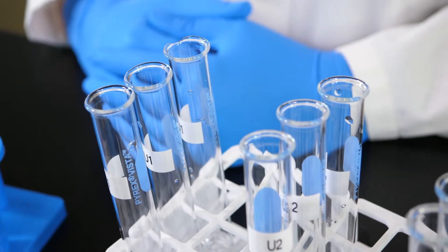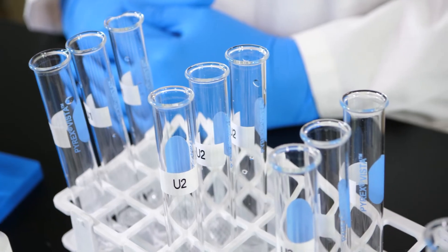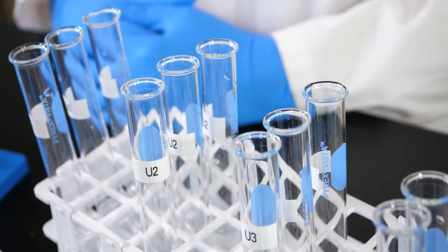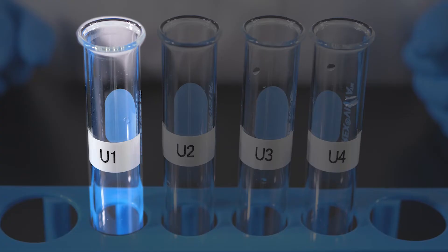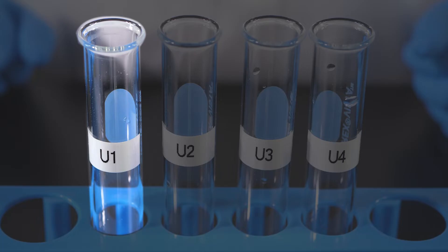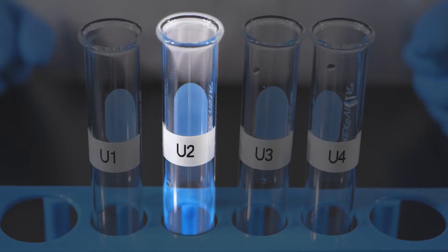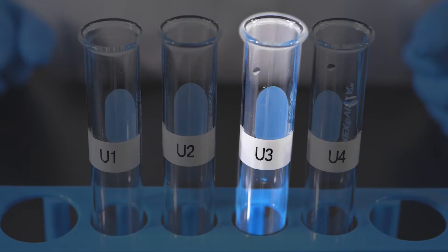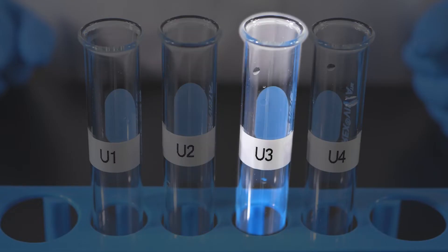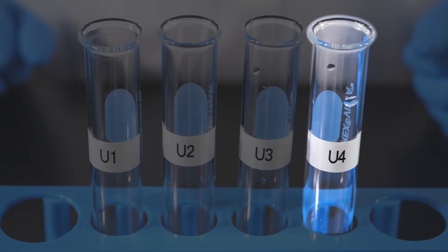We have prepared test tubes with samples of the four unknown solutions. The samples have been labeled U1 for unknown solution 1, U2 for unknown solution 2, U3 for unknown solution 3, and U4 for unknown solution 4.